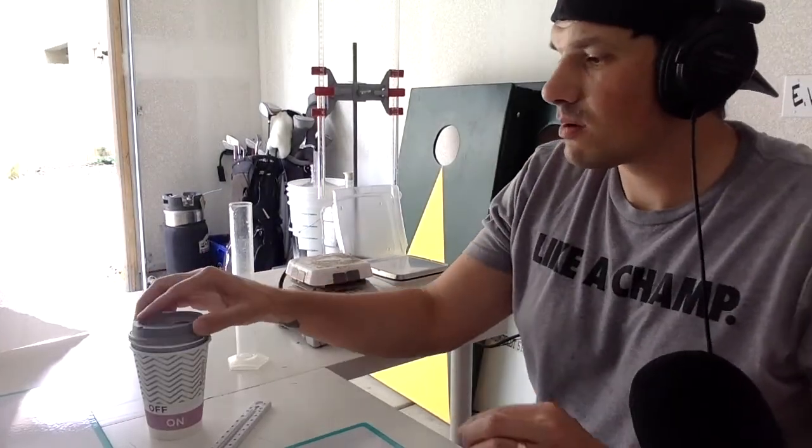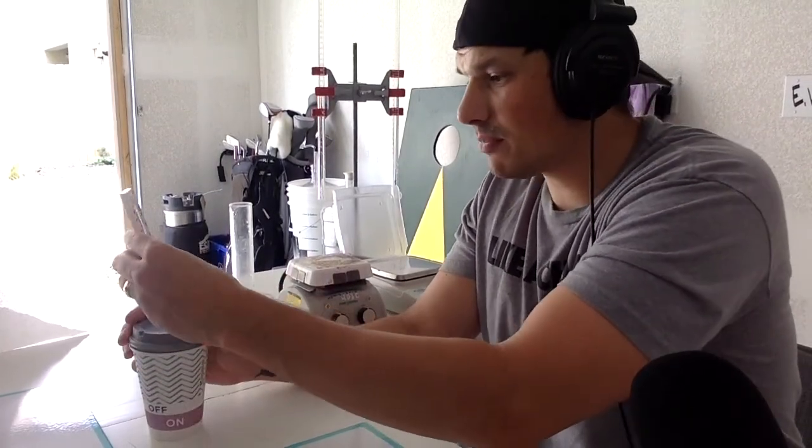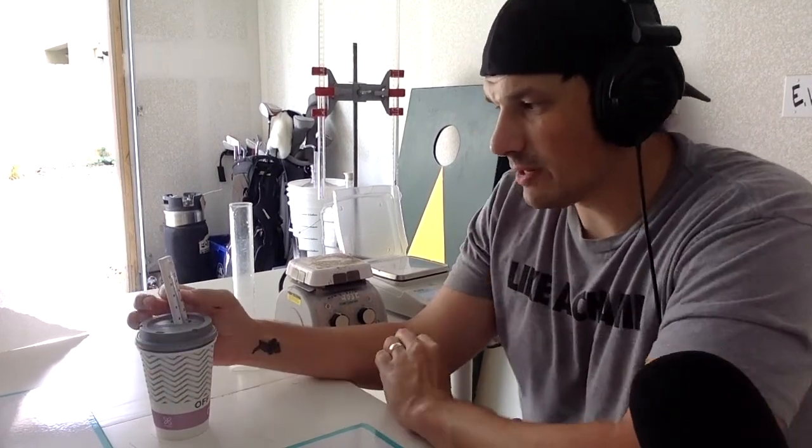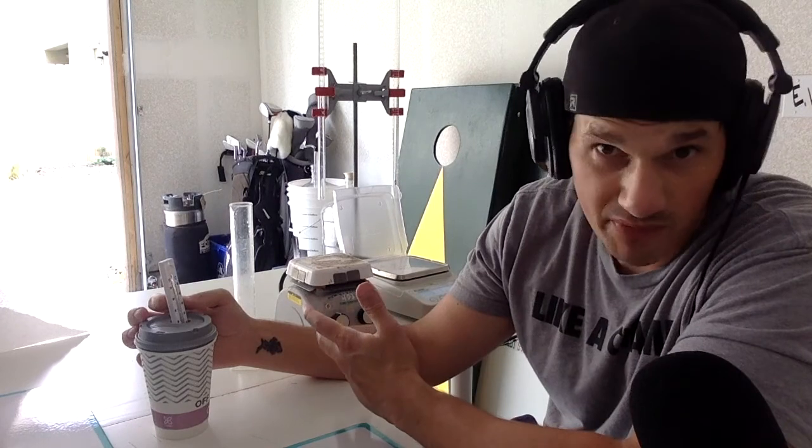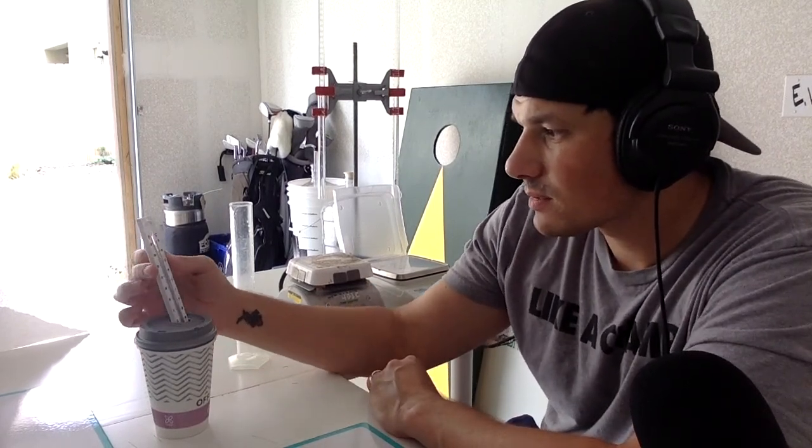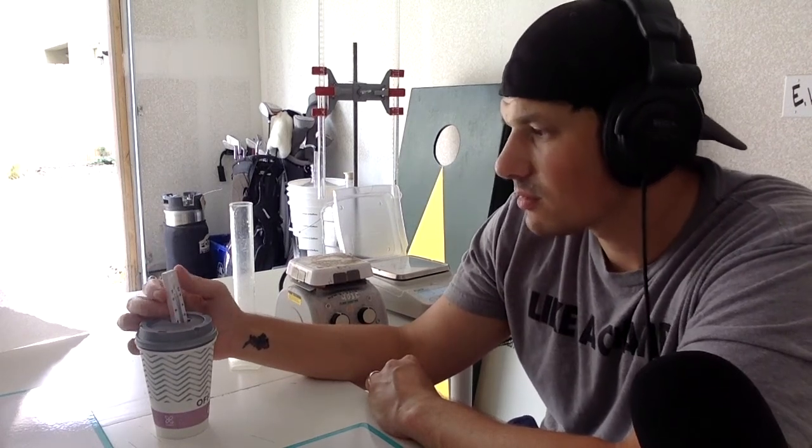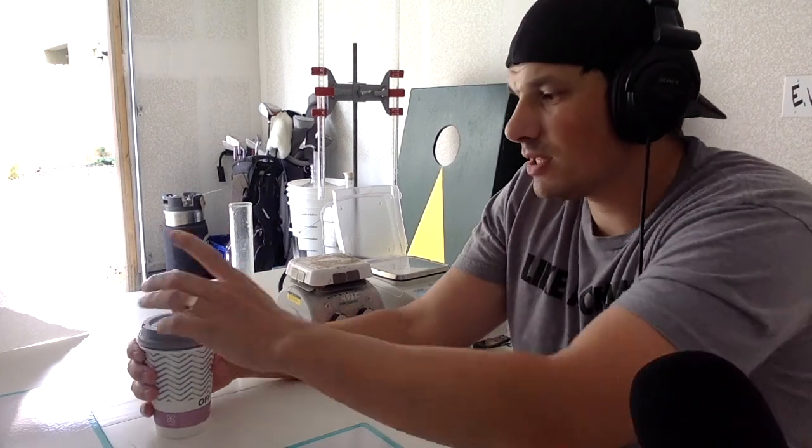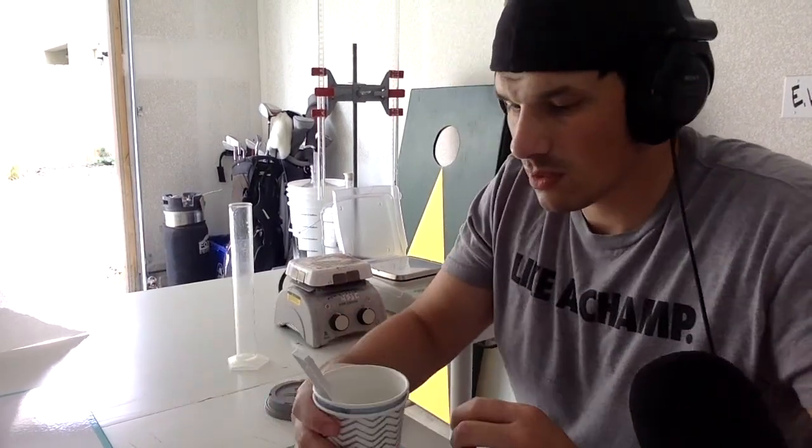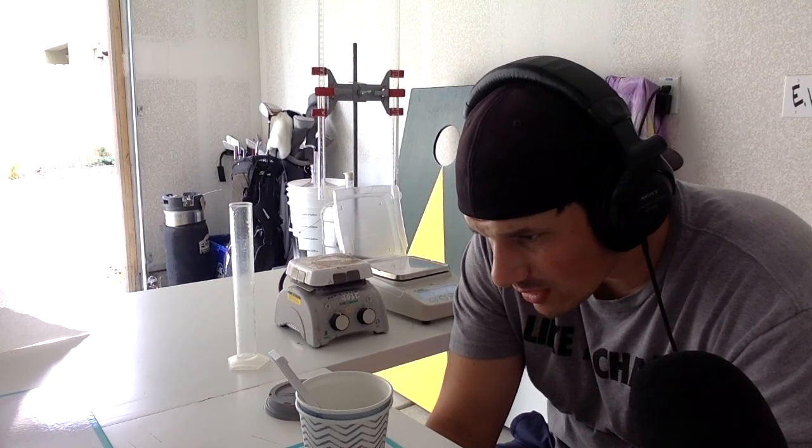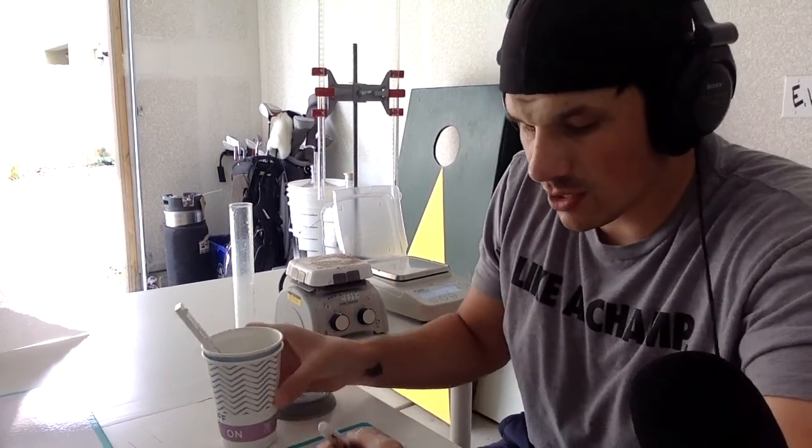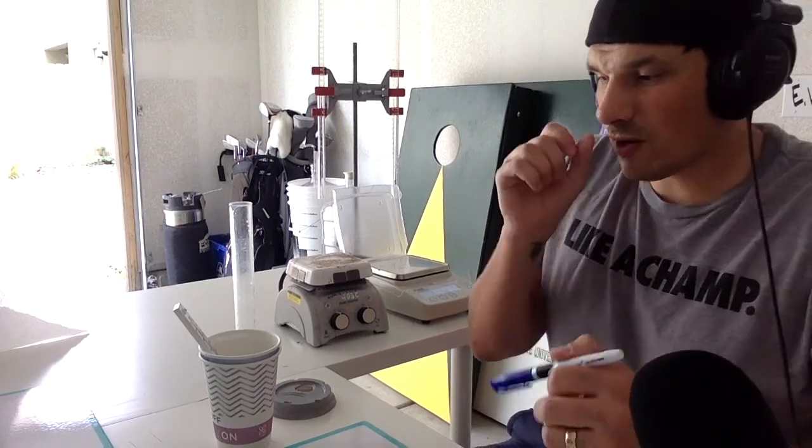Let's get this initial temperature. So I'm going to close my system up and I'm going to put my thermometer in and we're going to see what the temperature is. So already it's dropping right now. This thermometer goes up to 120 degrees. Obviously, we're not going to need that. Should be leveling out at room temperature. So right now I have it at about 70, 73 degrees Fahrenheit. We're going to go with Celsius is about 23 degrees Celsius. We're going to go with Celsius here. So initial temperature is going to be 23 degrees C. Then we'll see what our final temperature is.